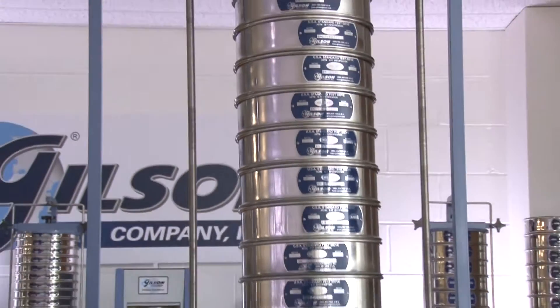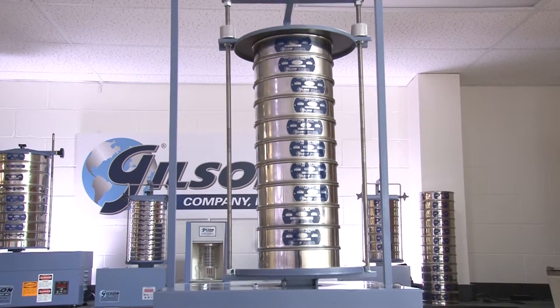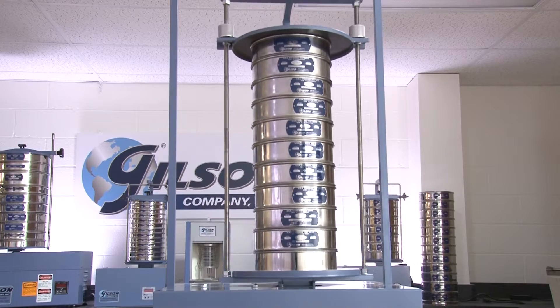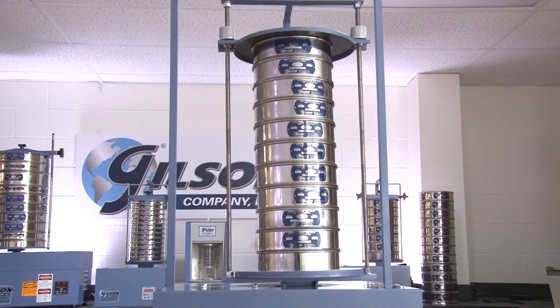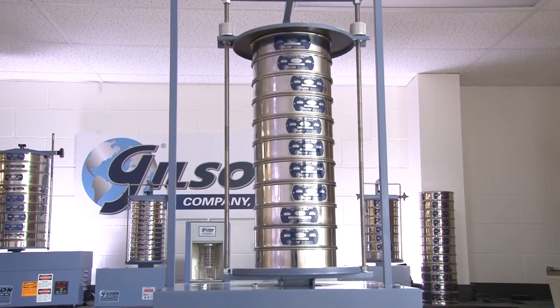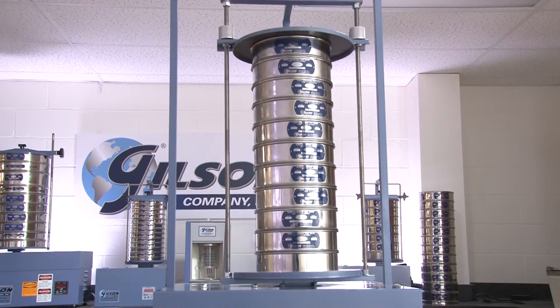Another consideration is which sieve shaker you're going to use. Some sieve shakers offer more vertical capacity and consequently offer more frame height options for the sieving process.